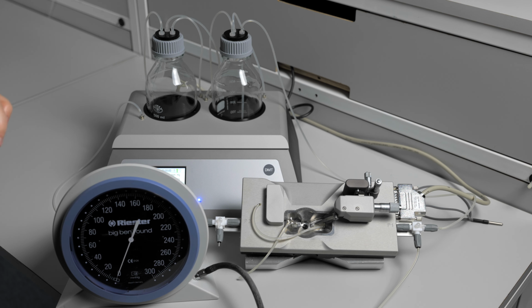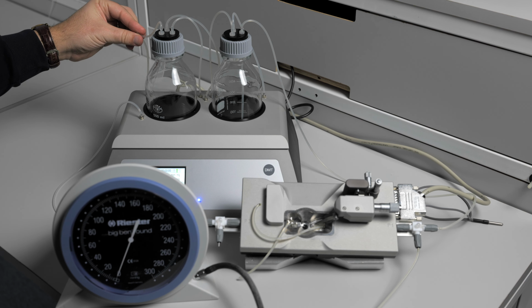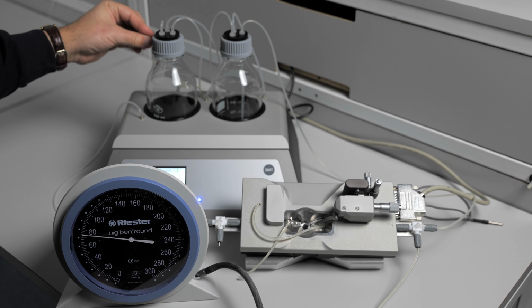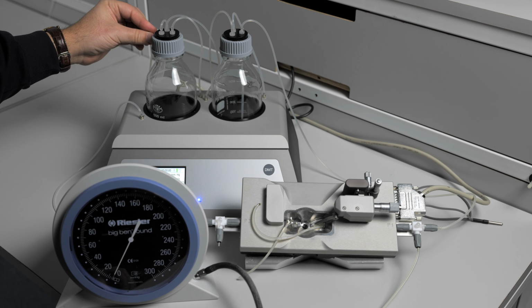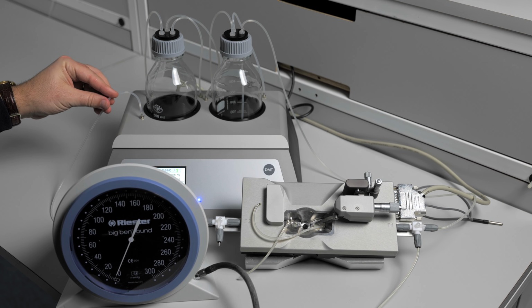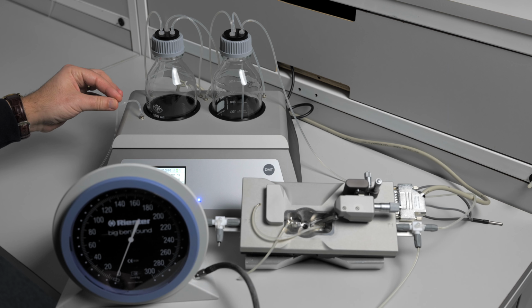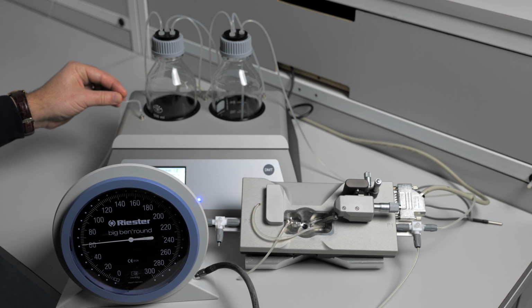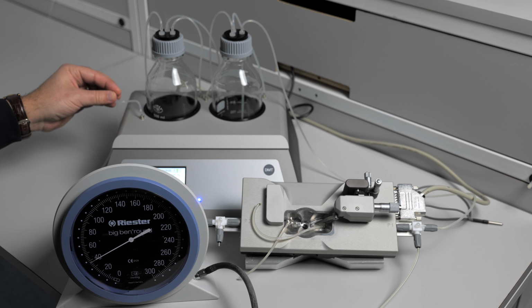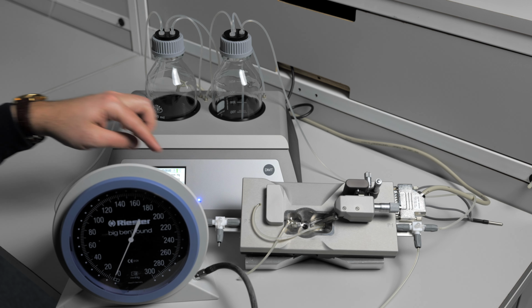To investigate the pressure leak after the chamber, you need to pinch the tubing that's going to the P2 bottle on your interface. Add pressure, and you see that pressure is still falling. We know that the leak is not in the chamber and it is before the P2 bottle. Now we will pinch the tubing before it goes into the interface. Add pressure, and we see that we are still losing our pressure, which means that the leak is not in the interface, the leak is in the tubing or the P2 three-way valve.